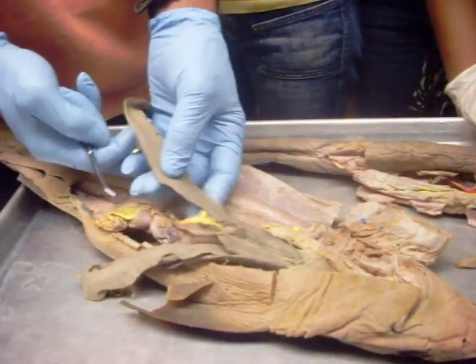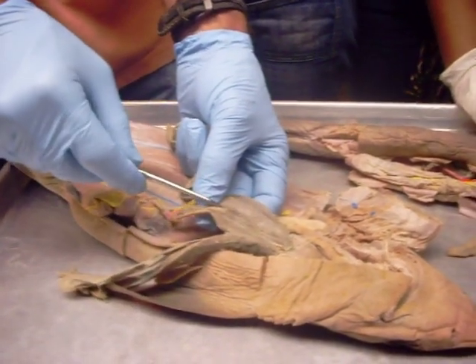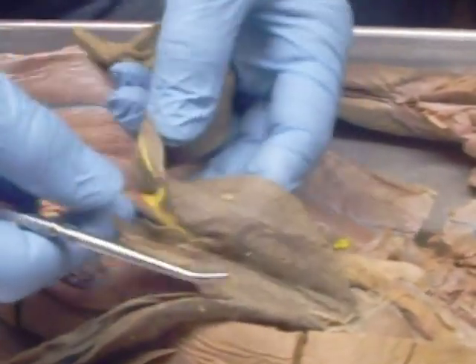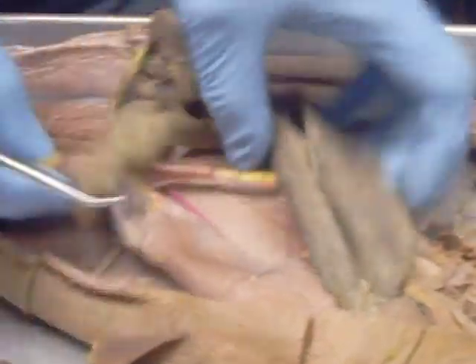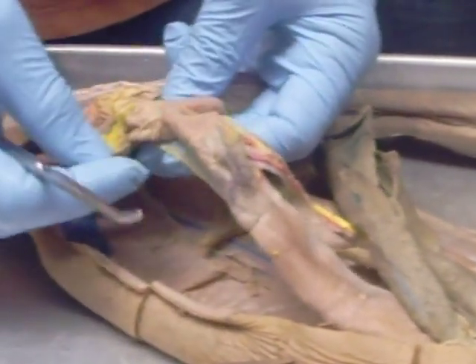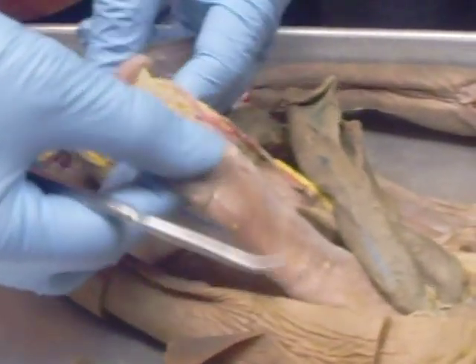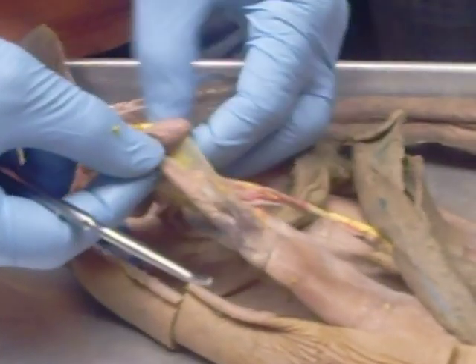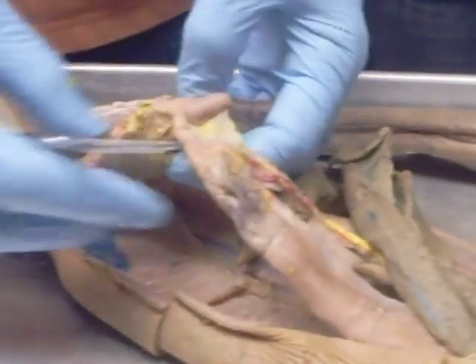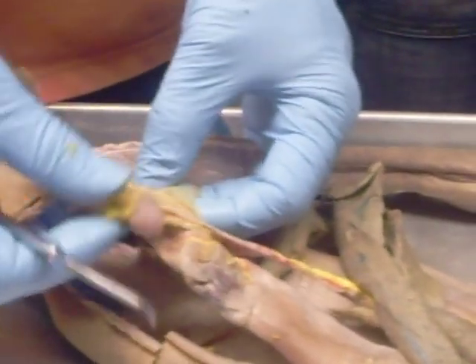As far as the digestive system — liver, you know, here. It's kind of hard to see because it's flattened, but this is the gallbladder in there, that little thin section. Then going back from that, you can always tell the stomach because the stomach is a J-shaped organ. To see the J-shape, you'd follow this down — this is going to be pharynx and esophagus. This right here where it curves back up is going to be stomach — here's the body of the stomach, here's the pylorus. And then we have the spleen, and we have the pancreas.